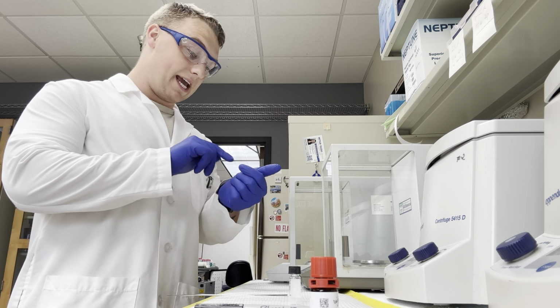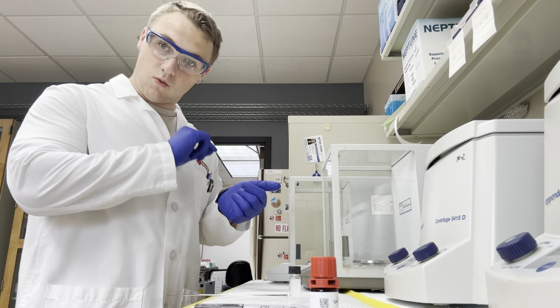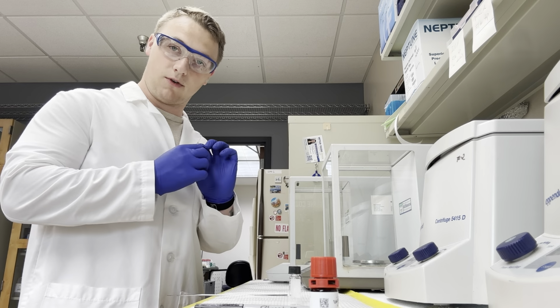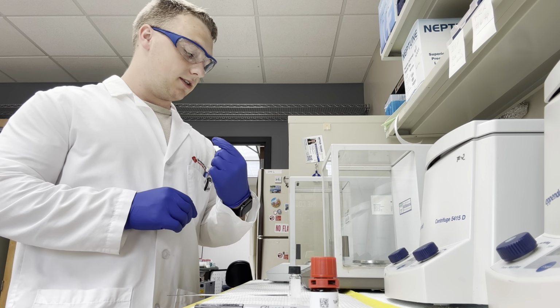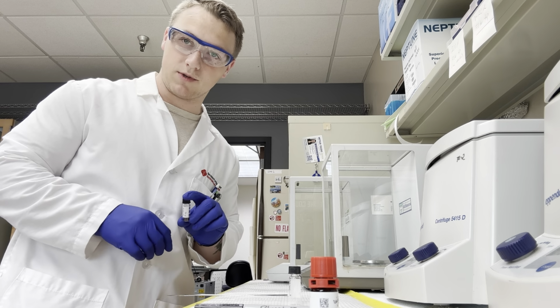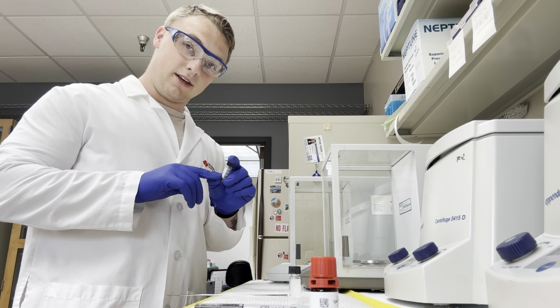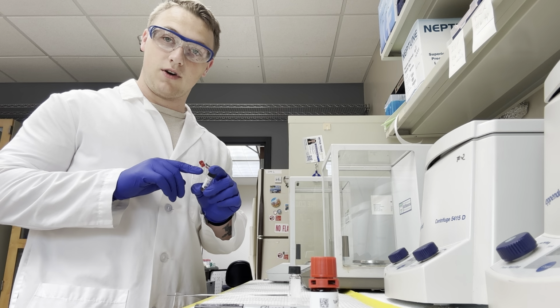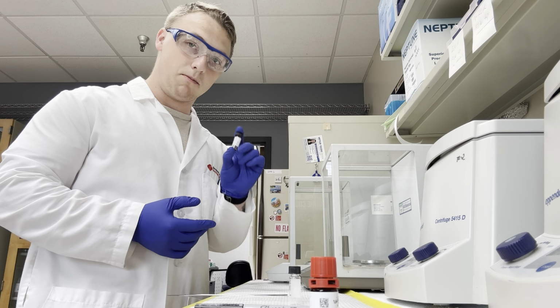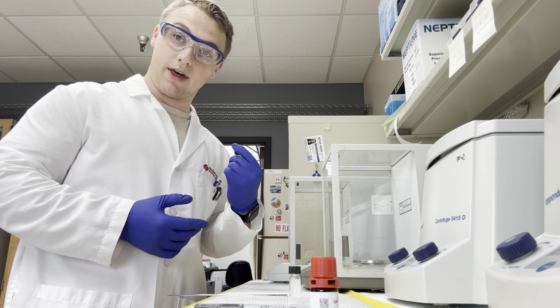What we're going to do is annotate on this blank strip on the side of the vial what it is, when we did it, and how much is in it. That's just for this first vial. So I've already annotated that it's Nile Red, today's date, and that we have 10 milligrams of our stock solution. Now we're going to determine, based on this weight, how much solvent we need to dilute this into our working 1 mg per mL concentration. So let's go figure that out.